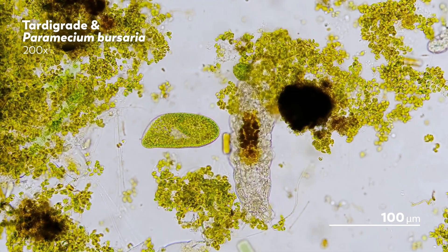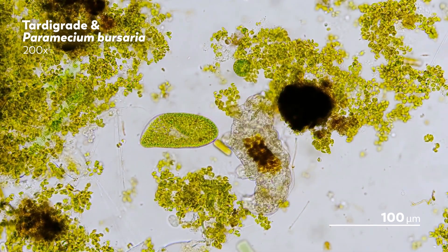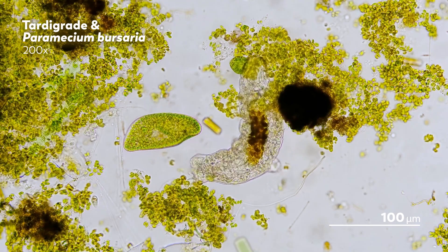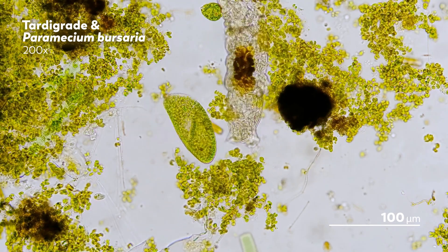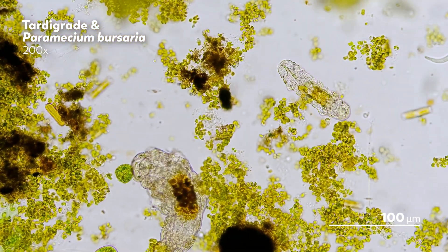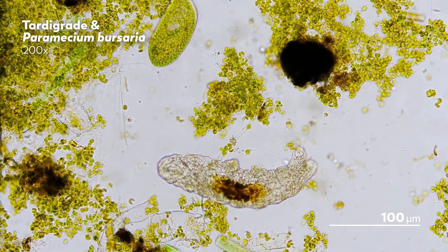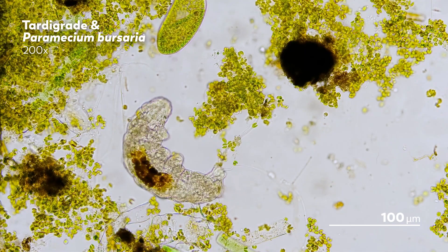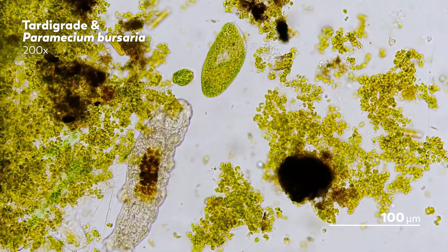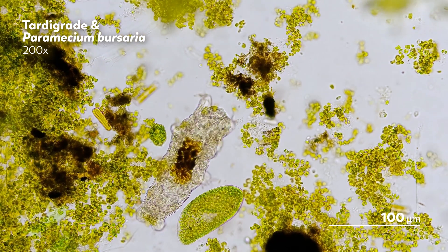Let's take the tardigrade as an example, but pretend that you don't know what tardigrades look like. You went down to your favorite pond, gathered some water, and now you're looking at what you collected through the microscope. On the other side is this delightful, bumbling bit of life. You see some stubby legs waving around, a pair of eyes, and maybe some strange things moving around inside its body. All those details are helpful — legs are a great clue, as are eyes. And inside, the moving things you're watching seem a bit like organs. If you weren't sure that you were looking at a multicellular organism before, you probably are now.